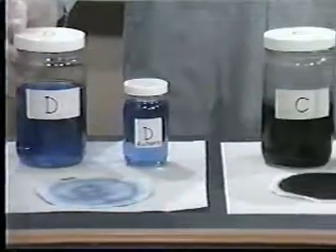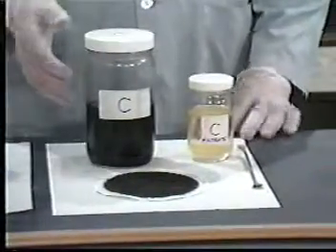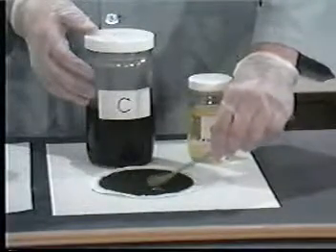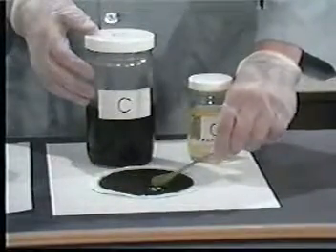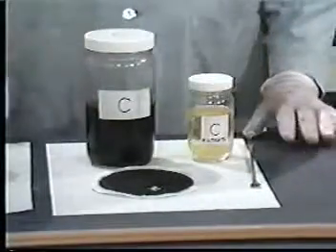However, if the percent dry solids is greater than 0.5%, as it is for waste C, then extraction of the solid portion will be necessary. Go back to the beginning of the previous step and use a new representative sample to make the 2 remaining determinations. At this time, determine whether particle size reduction is necessary.